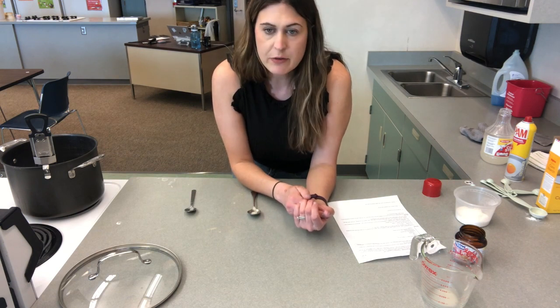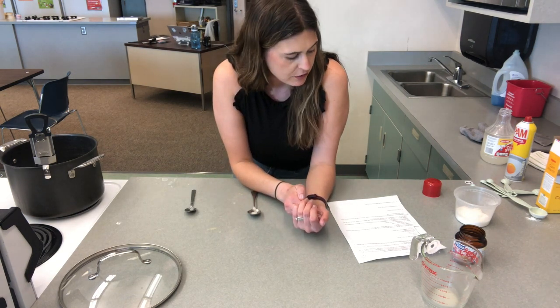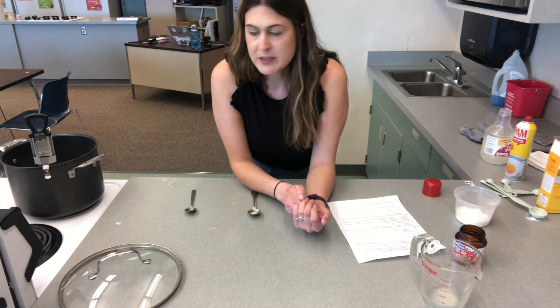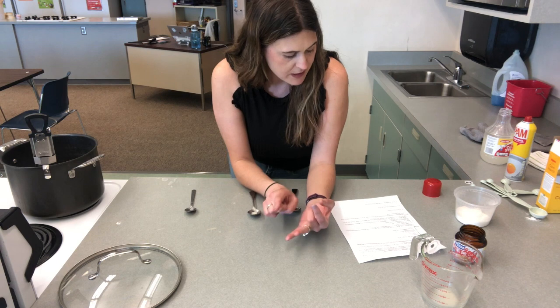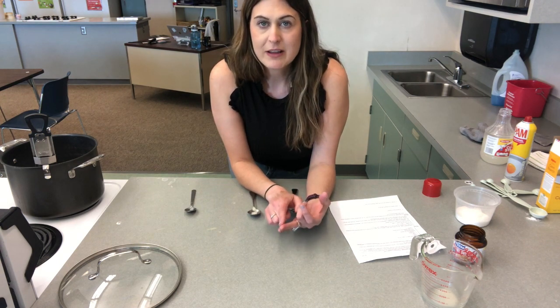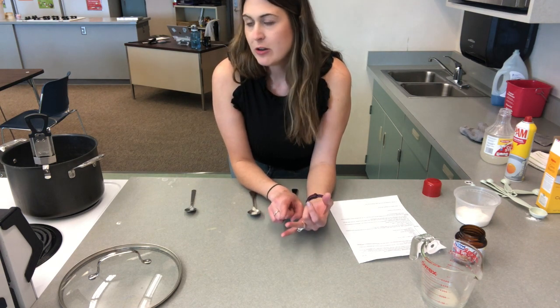So it takes a little time for the fermentation to start, so be patient. Just keep an eye on your temperature, and then take notes of anything that's happening. You're looking for bubbles, and you're looking to see how rapidly they start. So check the time and look for bubbles.